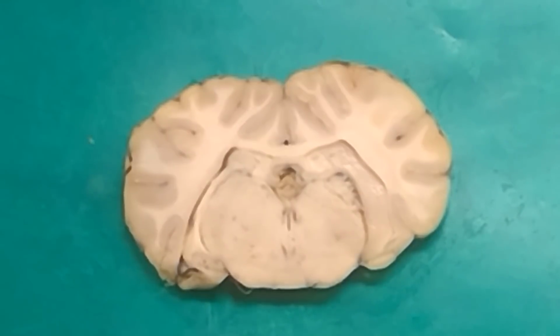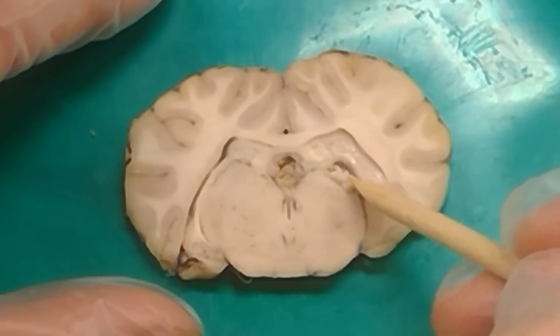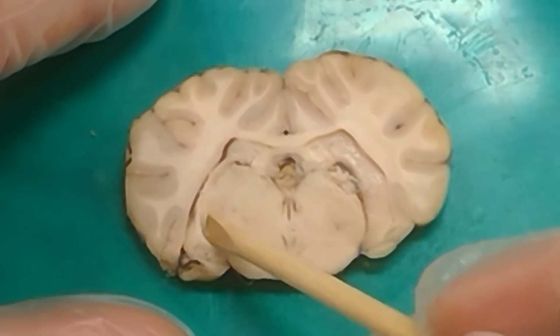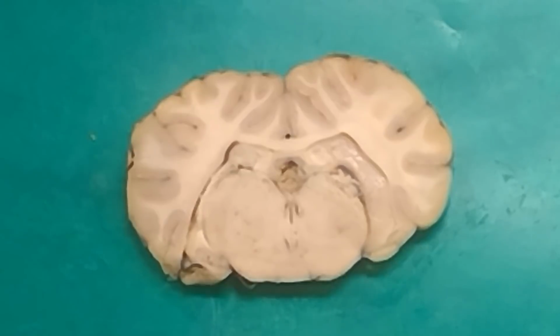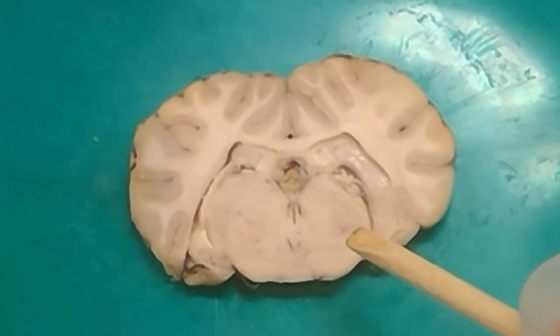Question: can you not see the LGN anywhere other than this kind of cut? Yeah, it's going to be at the very back end of the thalamus. It's on the lateral side, towards the very back of the thalamus. It is this bump right here on the side. It's also this kind of wide half moon shape right here. So it starts out as a large lump that becomes a bump towards the back lateral side. How would we best identify that?